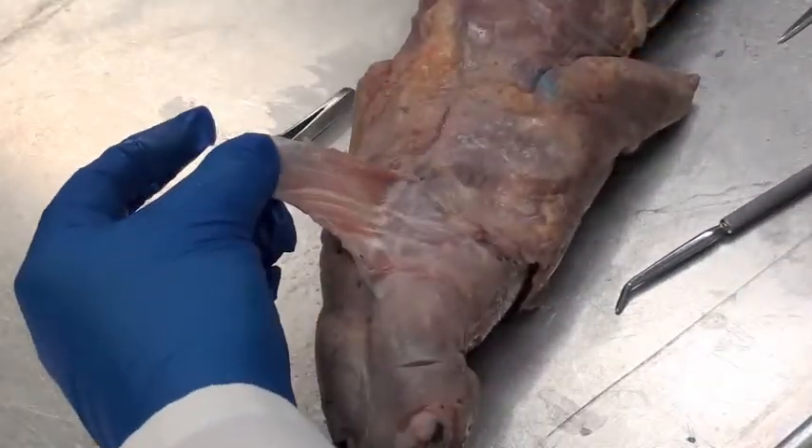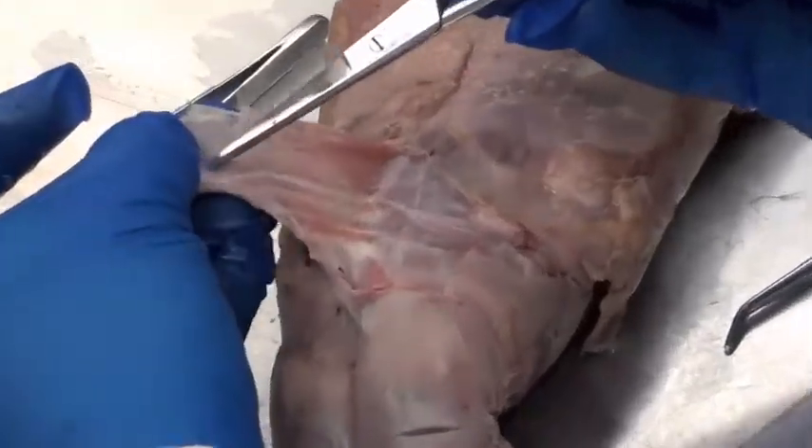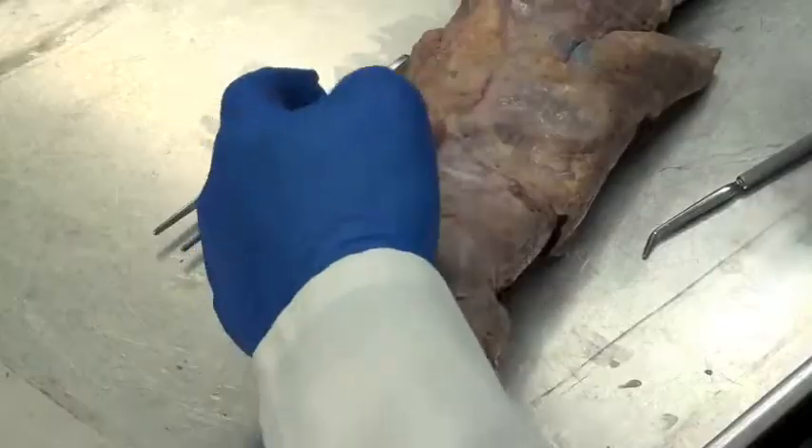The first part of that word — platys — means flat: a very thin, flat muscle, thin as a sheet of paper. So this is the platysma muscle. Look how thin it is — you can almost see right through it. It's like very thinly sliced lunch meat. More meat references — I love doing that in this lab. So that's platysma.